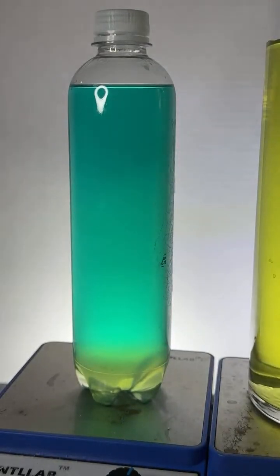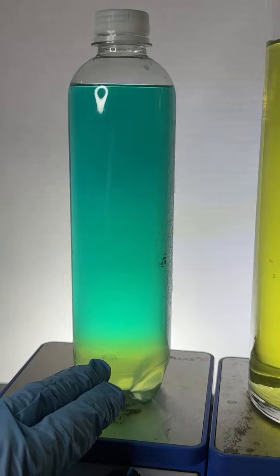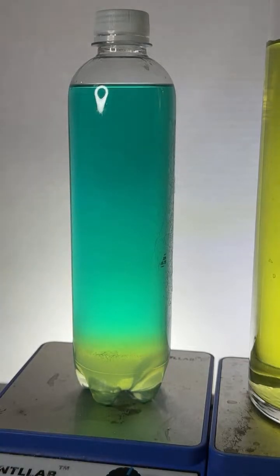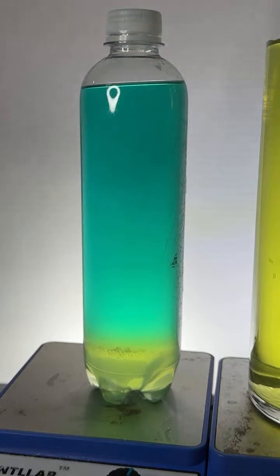That has to do with the fact that the dyes are attracted to those molecules through a number of means. We'll just talk about one of them. One of them is called hydrogen bonding. And things that are going to hydrogen bond better are going to end up in the water layer. And it turns out that the yellow dye has more ability to hydrogen bond with water than the blue dye does. And that's why the blue dye ends up getting salted out.